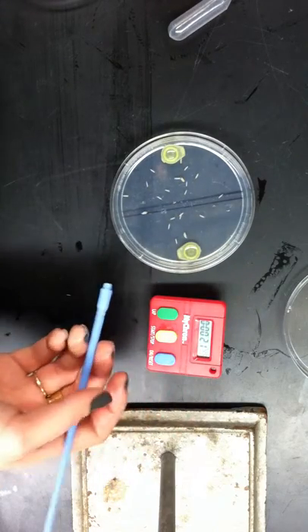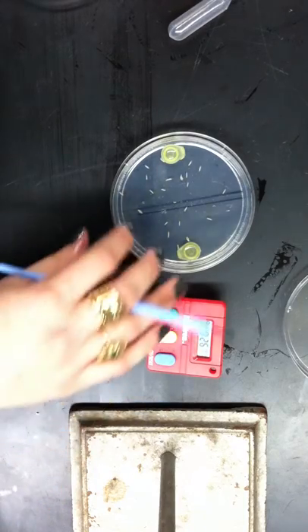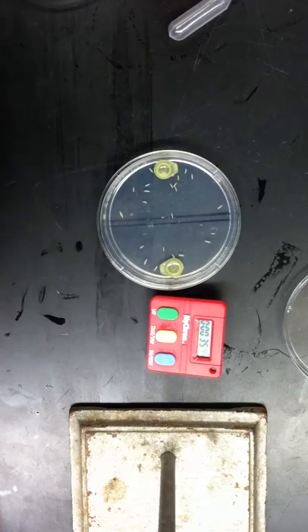Here you can see it's really random, so the results are probably going to be insignificant. But there was no variable involved, so that's probably very common. It depends on what you test and what you test on their memory. And after three minutes is up, you can count either side and then calculate their preference score.